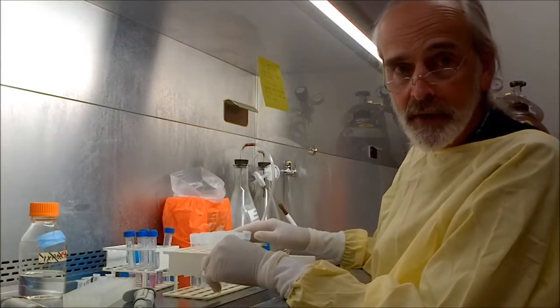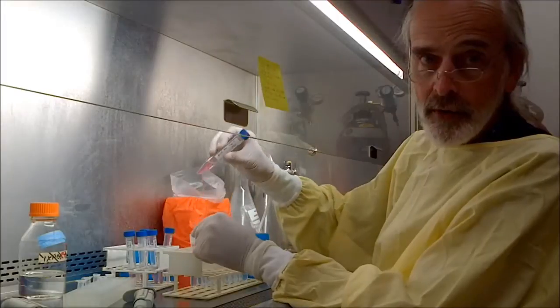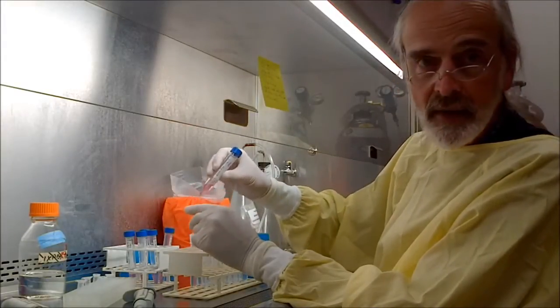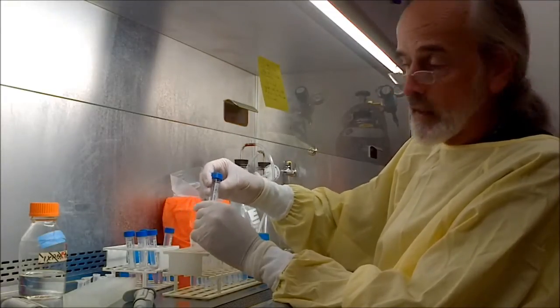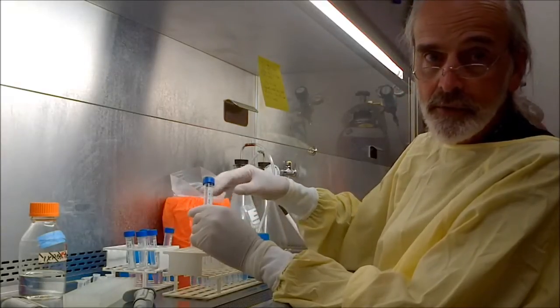So what I'm going to do first is take my 0 hour. In other words, we just put the virus on and then we took it off right away. It just is like a baseline for us. And I'm going to take this and create 3 different dilutions.